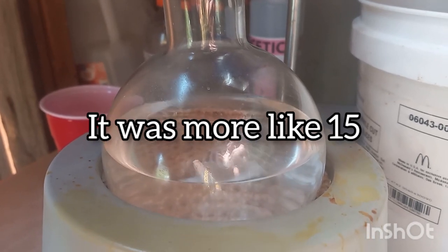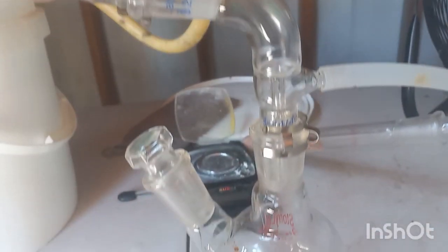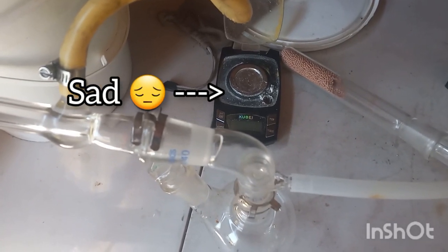So got that. It's going to be heating up, and then we got our condenser here. Now all this crap is on the side of the flask, not inside. And then we got a drying tube with freshly charged molecular sieves, and my scale that's looking really sad.